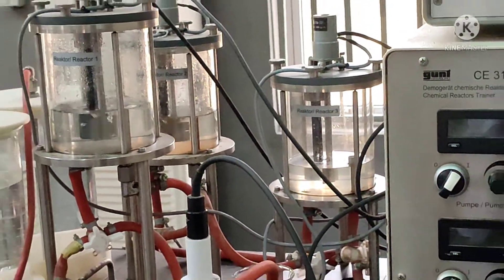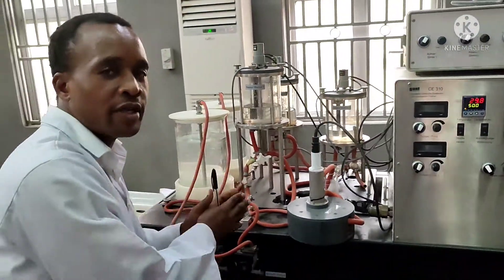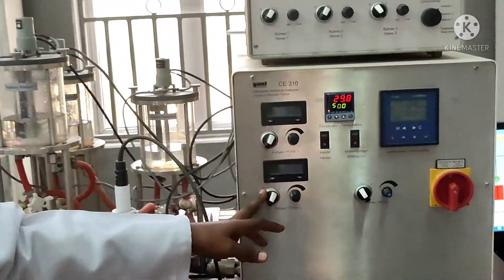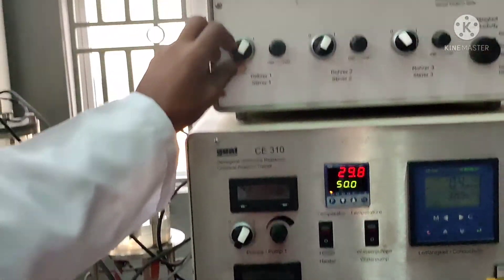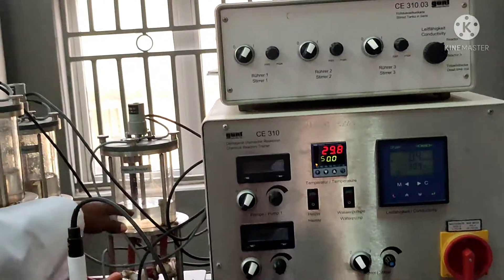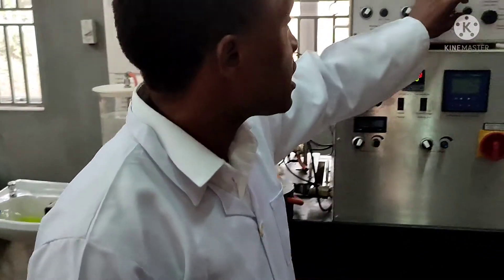We want to set this at the same stirring rate. We set the pump at 80, and the other one too at 80. Then the stirring of the first reactor at maximum, and the second one at maximum. We also put fluid into the third one and set the stirrer for that at maximum as well.